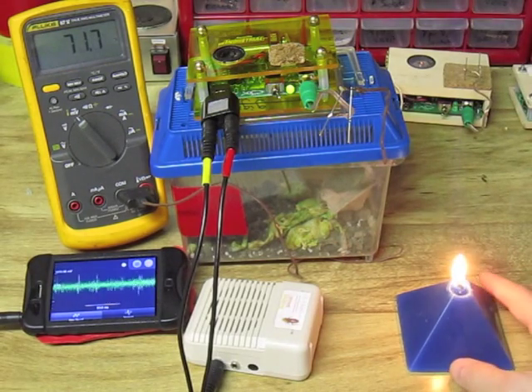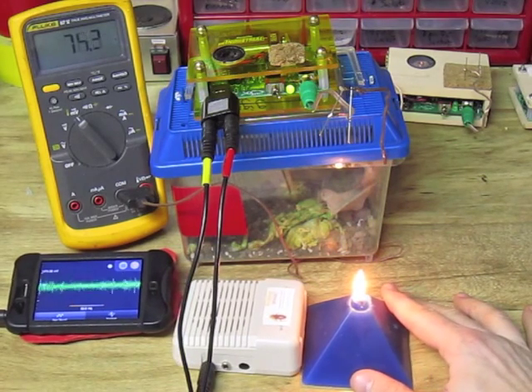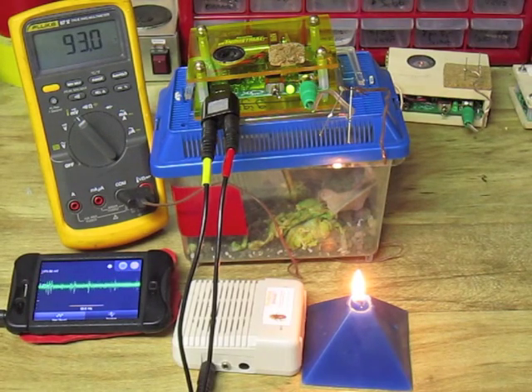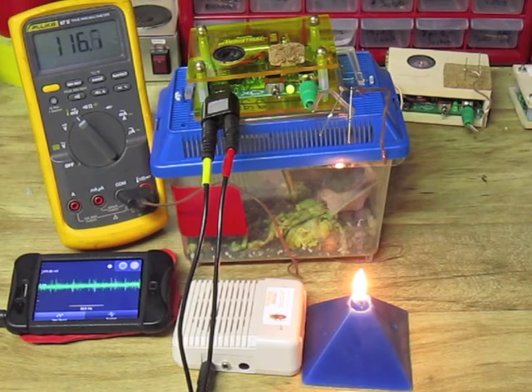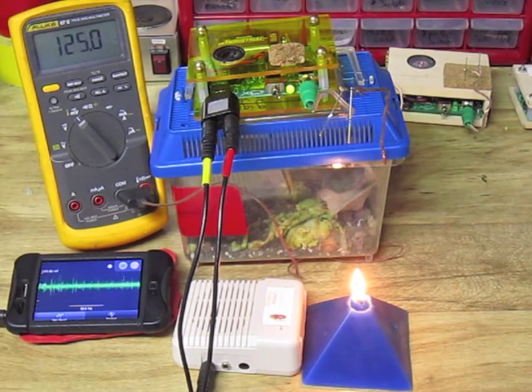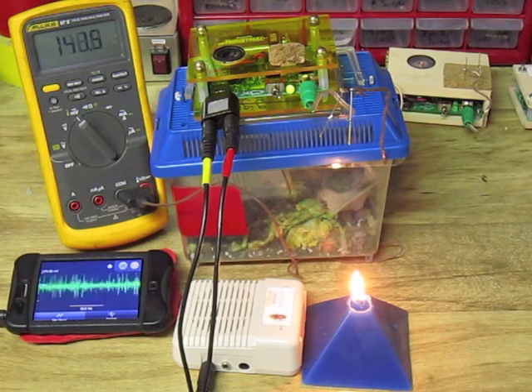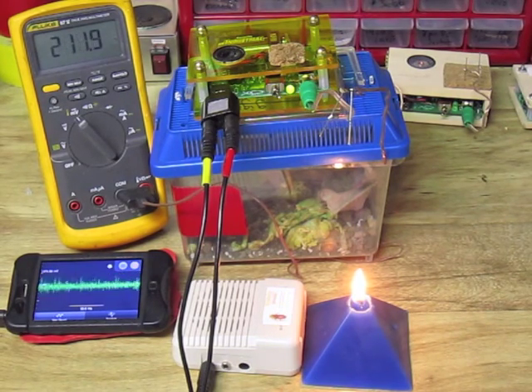Now I will move the flame directly underneath the cockroach leg to slowly heat it and see the effect of rising temperature on neural activity. Wow, I immediately see an increase in firing rate. And at 120 degrees, the neurons discharge all their ions and in effect begin dying. And at 160 degrees, the tissue gives its last breath of electricity.